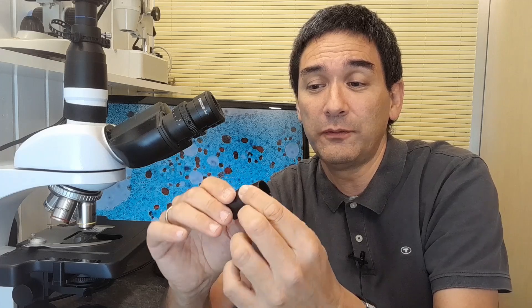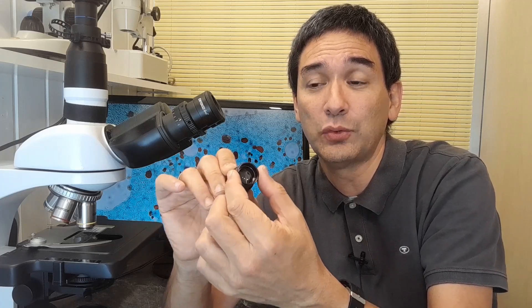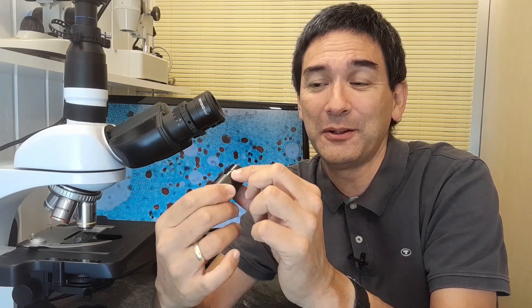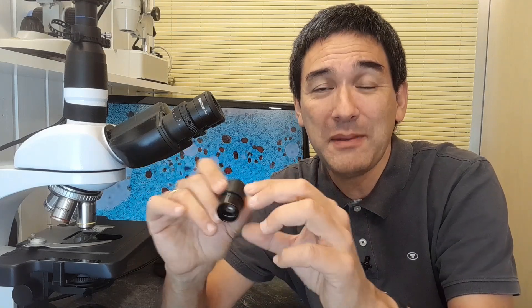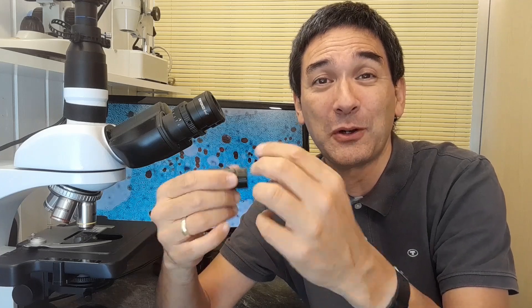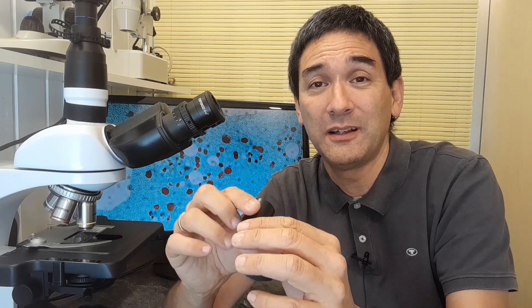Even this one over here has 23 millimeters across on the outside, but the inside diameter is significantly smaller — only approximately 16 millimeters. This makes the lens significantly cheaper because the optical elements can be smaller. For this reason, when you look through it, you're only able to see a significantly smaller area of the specimen. That is something I would like to illustrate using a few examples.